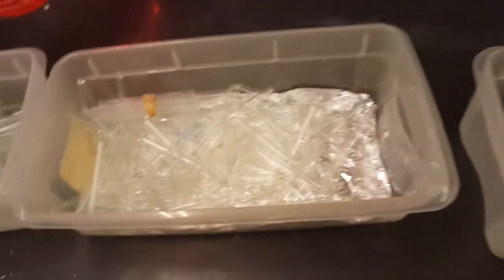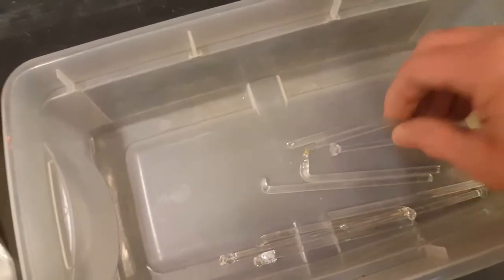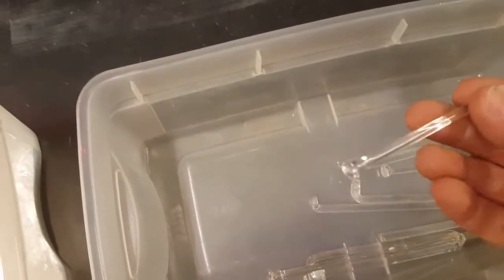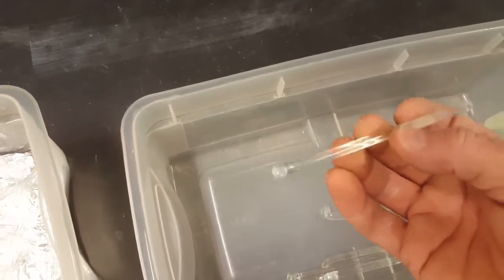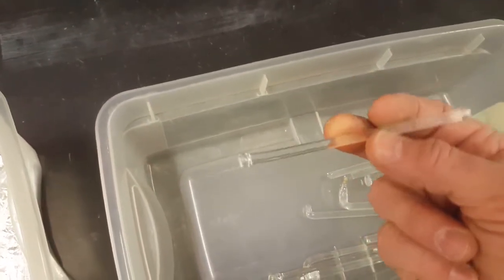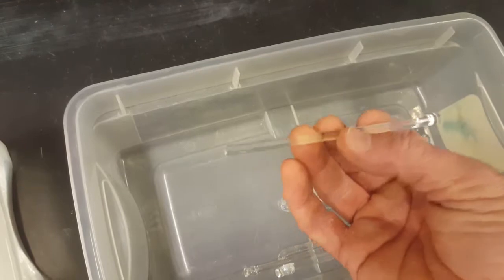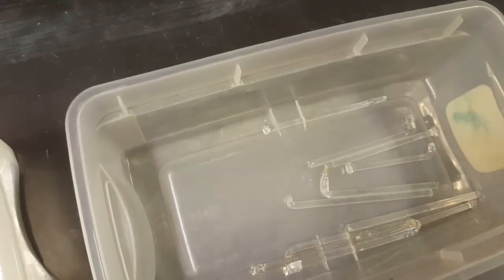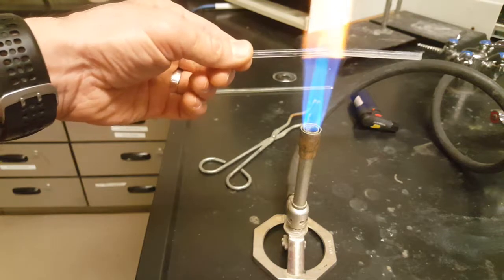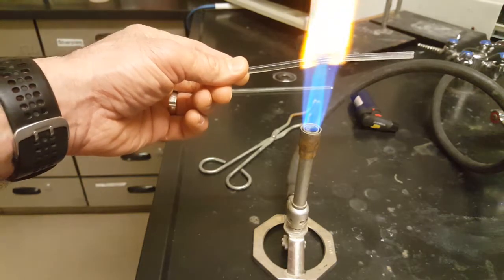When you're all done making your stir bar, we have three bins full of glass tubing and stir bars that are just too short to be functional. We'd like you to have an opportunity to bend some glass and play with it. You can make hearts, stars, little tiny Santa Clauses, reindeer, or menorahs if you would like. Put them in or give them to people for the holidays. Here's an example of what you can do with the short stir bars that are too short to be stir bars.